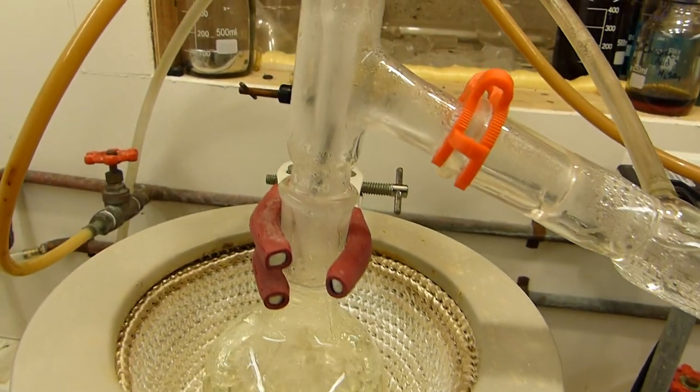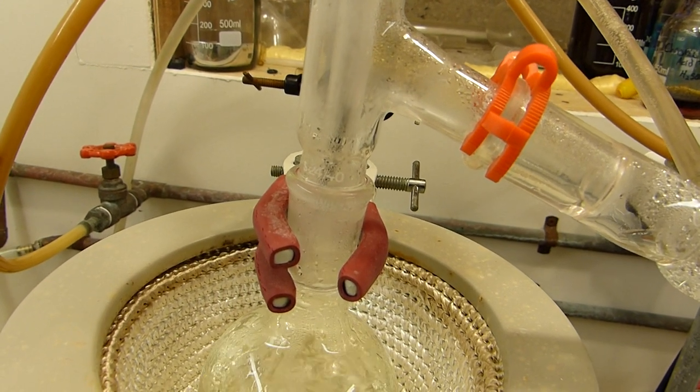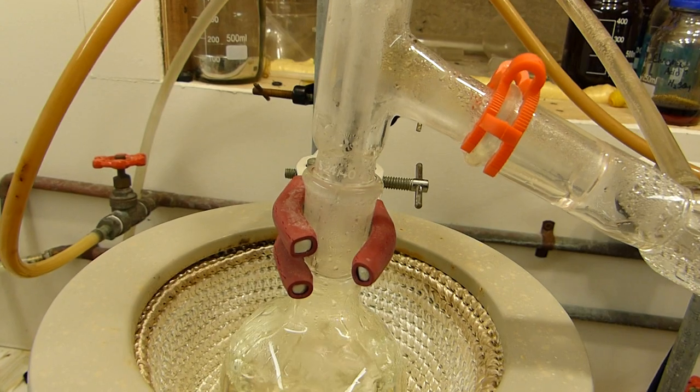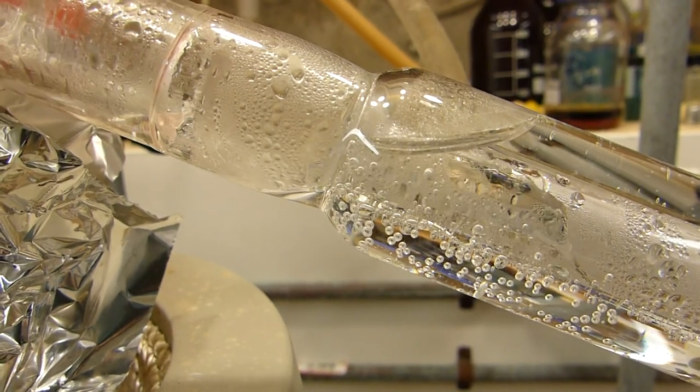And speaking of which we are just beginning to boil and the vapor head is now moving into the still head there and yeah we'll be collecting pyridine in no time. Pulling it over at a pretty good clip now.